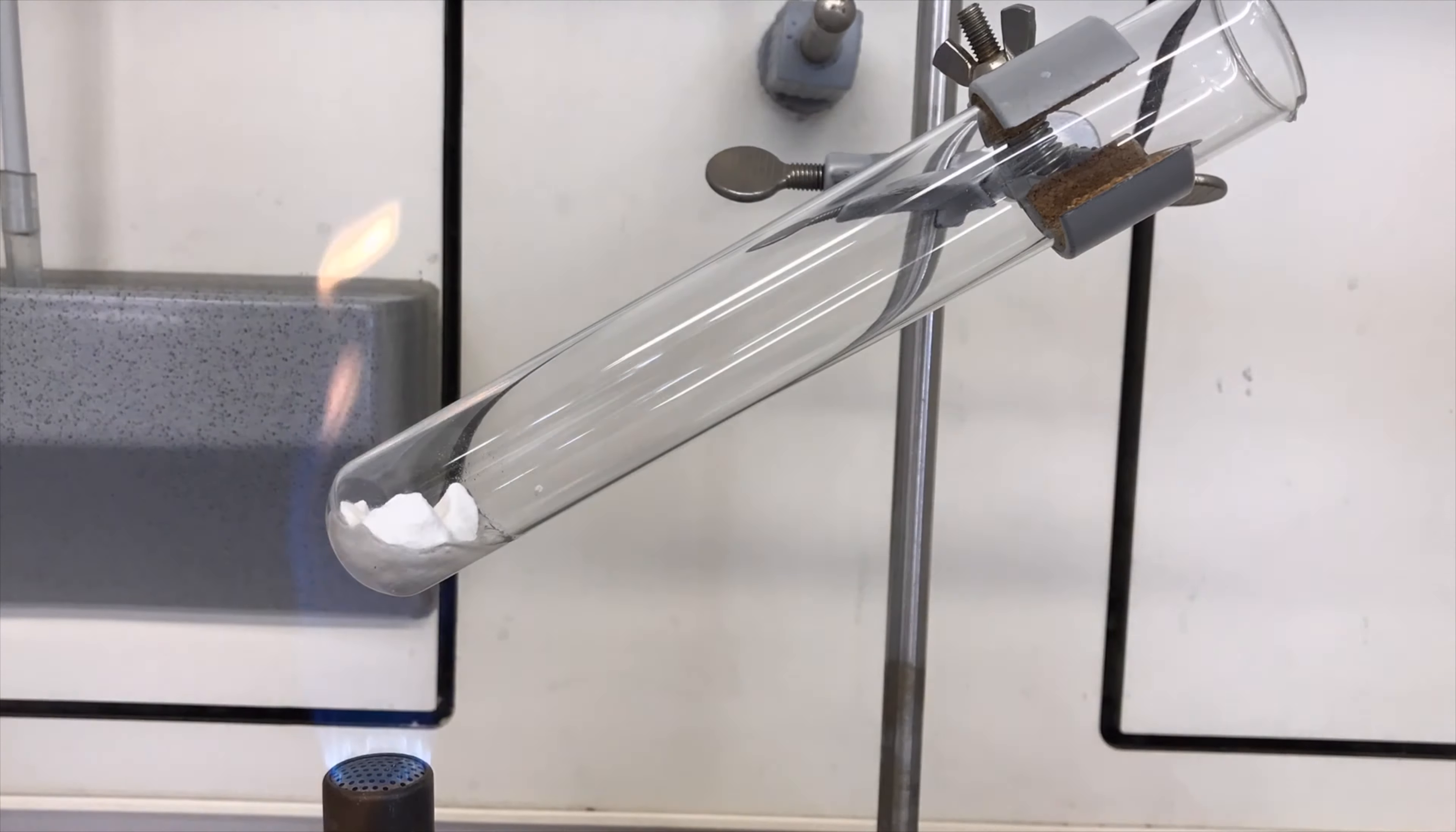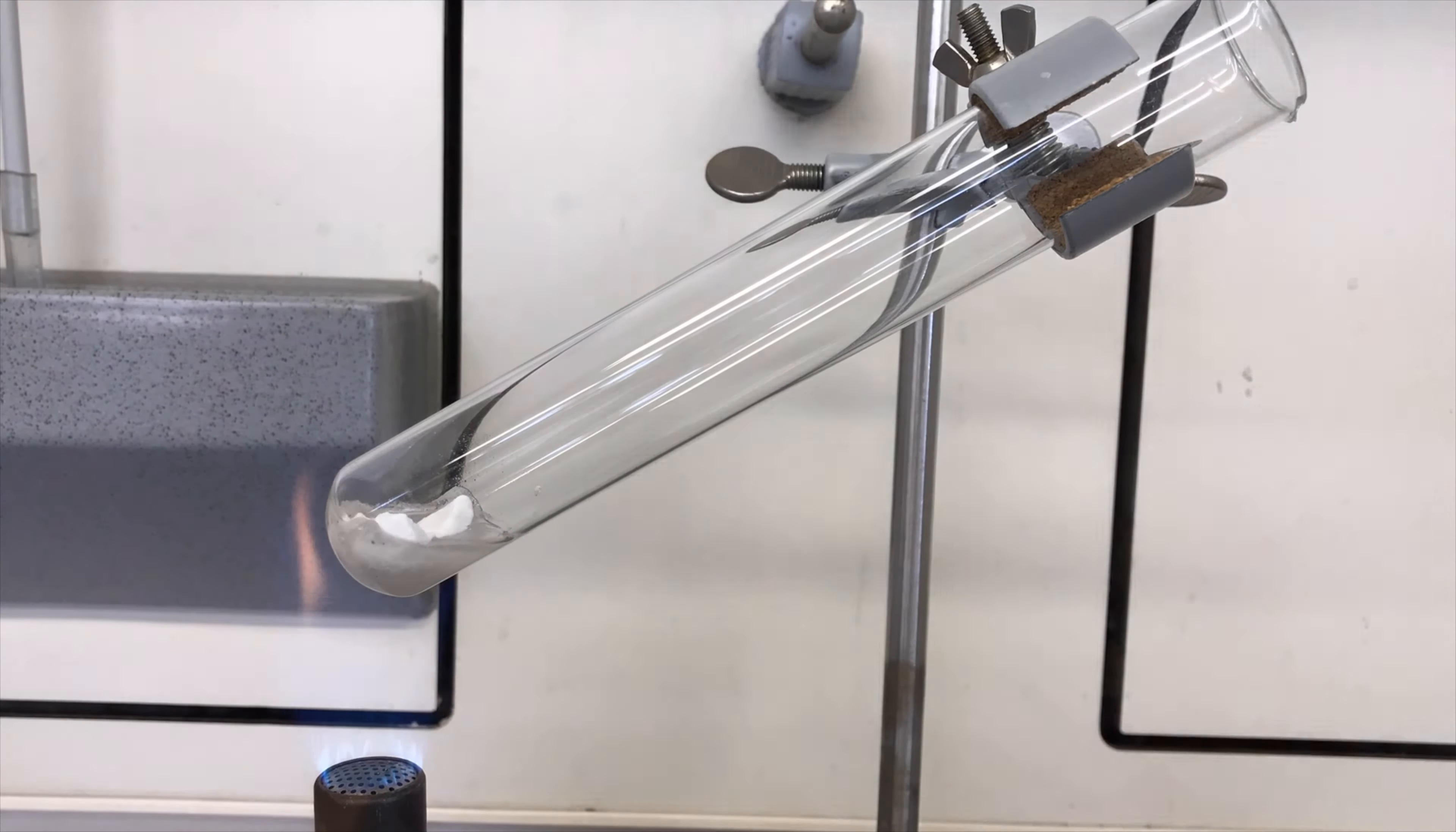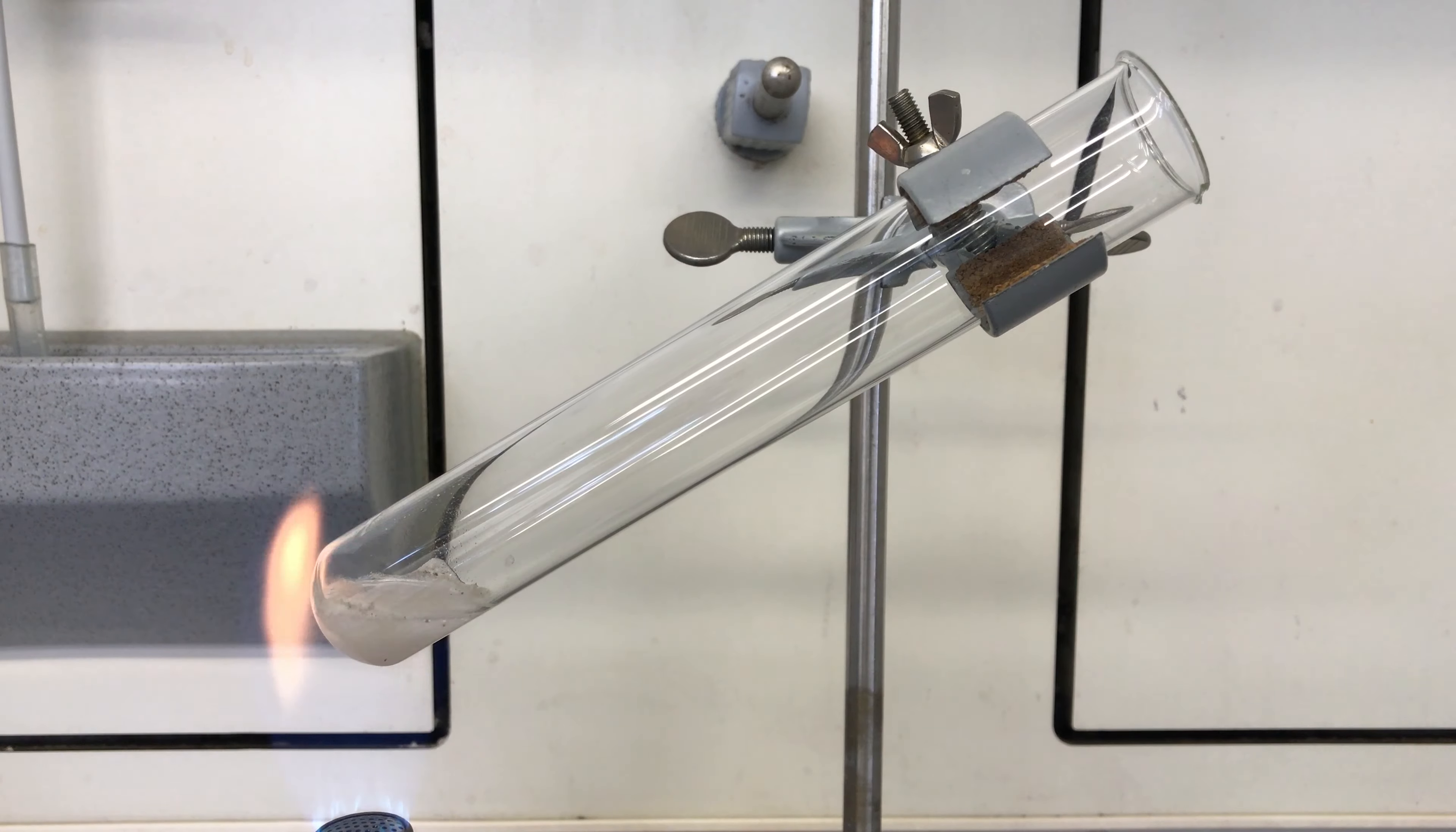There's something we can learn from this experiment. Molten potassium nitrate is boring. This time we are using potassium chlorate.